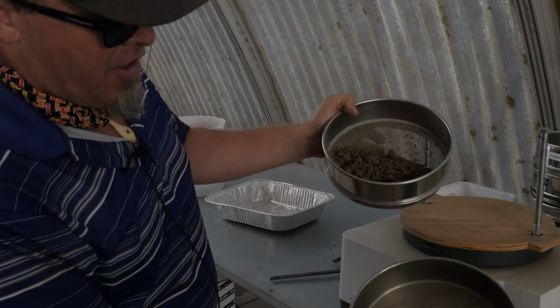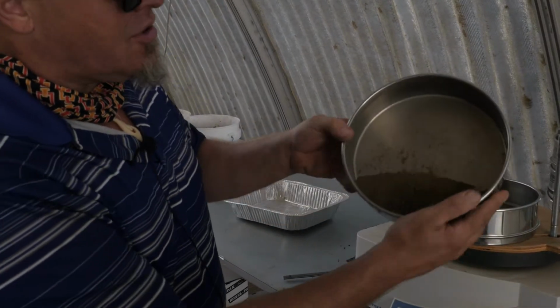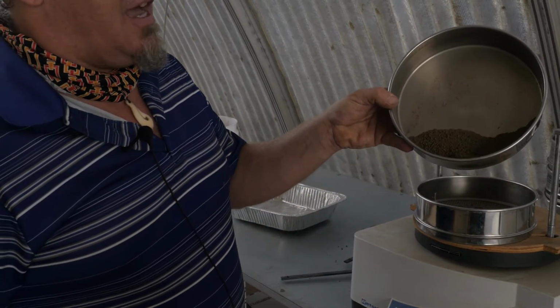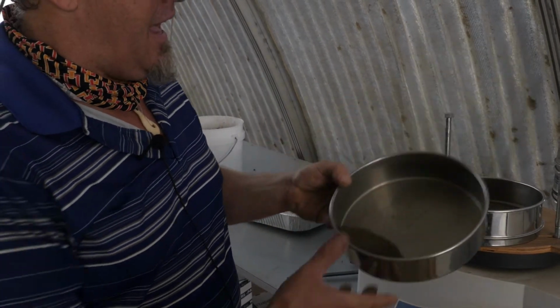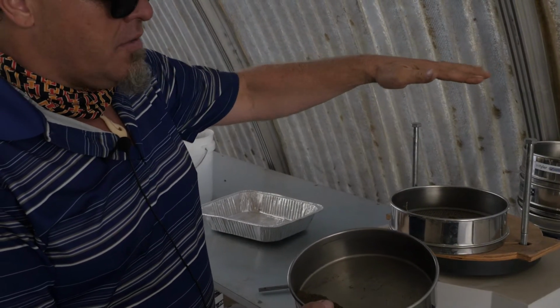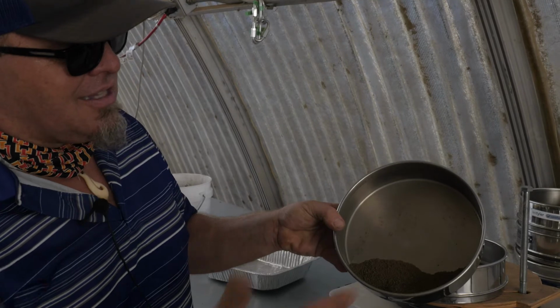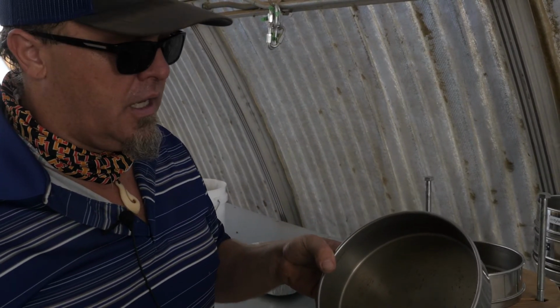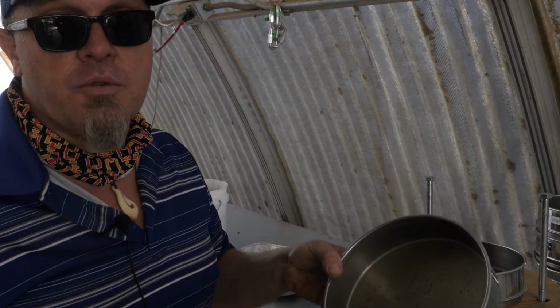Inside that 2 millimeter, we have our fine fraction soil. This is what everybody talks about with those 3 particle sizes, right? Sand, silt, and clay. This 2 millimeter sieve excludes things larger than 2 millimeters and allows everything less than 2 millimeters to fall through. So you could start to work with this soil and do a bunch of other things we're going to talk about this semester.